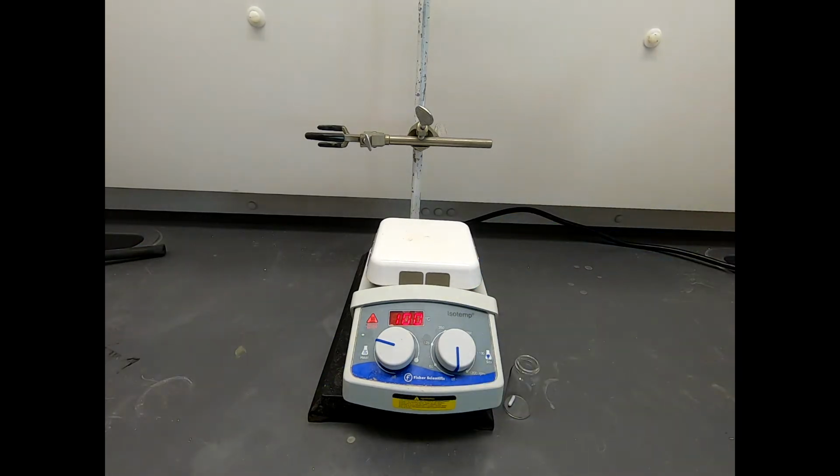I confess, as far as most chemists go, I'm a little bit older, and I learned chemistry at a time when fewer people wore gloves. And I find that gloves make me somewhat clumsy, so I tend not to wear them. But there's a reagent we're going to work with in this experiment that I will wear gloves for. So gloves are a protection, and there are times when you absolutely need protection. There's no argument against it.